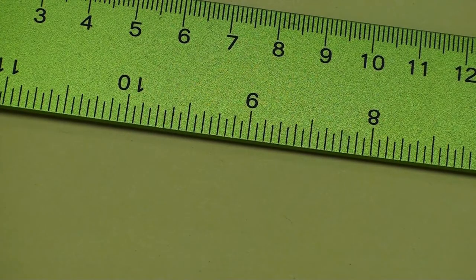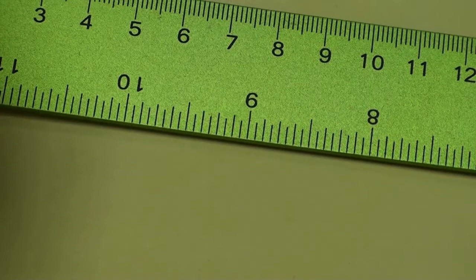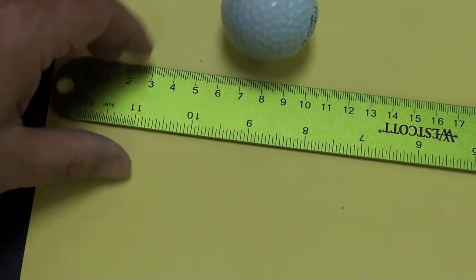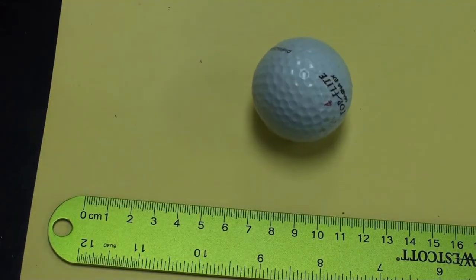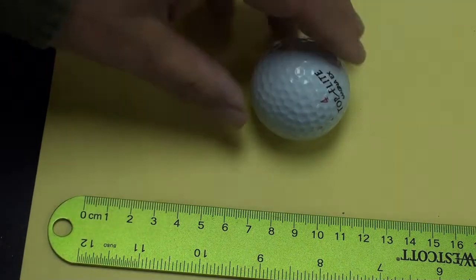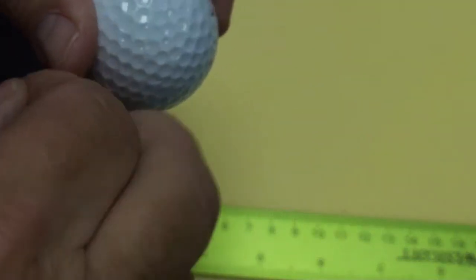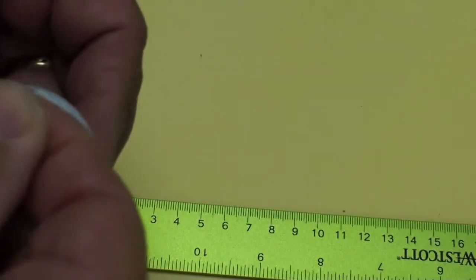The next one, which is a little bit strange, is going to be the golf ball. You're probably thinking that was going to be, I'll probably have to tell you some things on that one. So, we need the formula 4/3 pi r cubed, but of course we can't really figure out the radius by cutting it in half. So what I'm going to try to do is bring this string, this fishing line, around it.